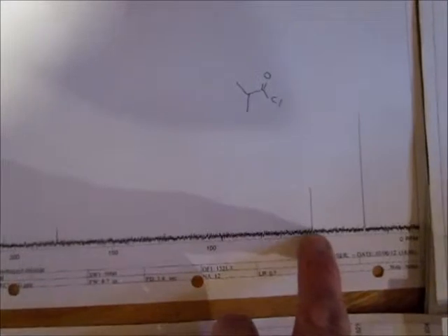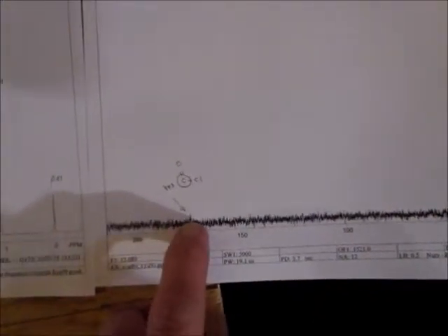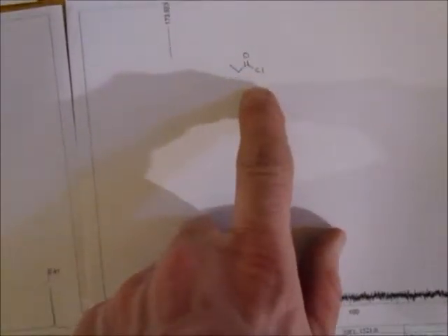Then we look at the carbon of the acid chloride. The carbonyl stretch down near 177, and then the CH group, and this is the CH3 group. The newer compound, we took it this year, we didn't have a very concentrated sample, so the peak is very small, but this one says yes, it's the carbonyl carbon. In this compound, this year's, 173, call it 174, and then you're going to see 2 other peaks here. The CH2 group, which is at 40, and then the CH3 group, which is at, let's call it 9.